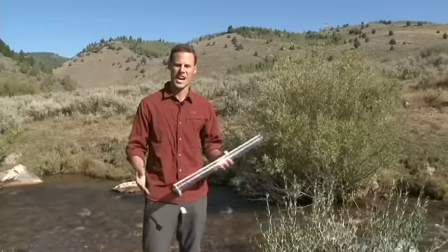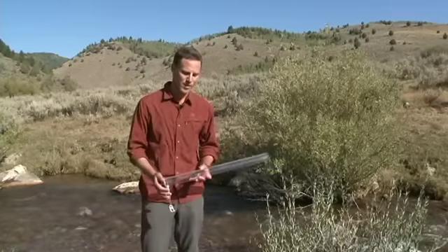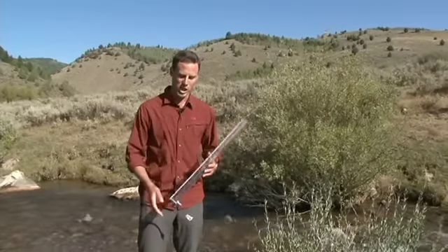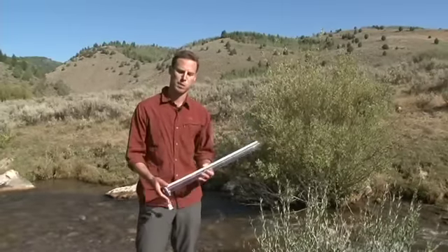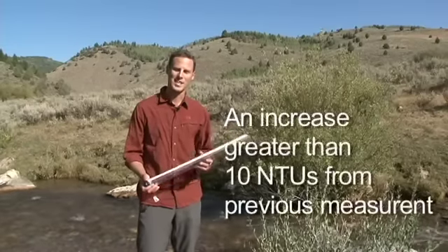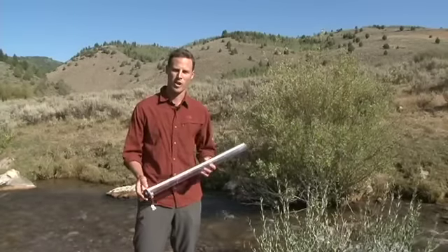Turbidity is something that varies naturally in all streams. Think about how clear this stream is versus the color of the Colorado River. What we don't want to see with streams is extremely large changes. They have seasonal changes from when we have high flows in spring during snowmelt and high runoff periods, but we don't want to see very large changes, because that could be a sign that something in the watershed is causing too much erosion, too much sediment, or too much plant growth in a stream. In Utah, for recreation and for fisheries, we never want to see an increase greater than 10 NTUs from our previous measurements. That's the water quality standard for recreation and warm water and cold water fisheries.